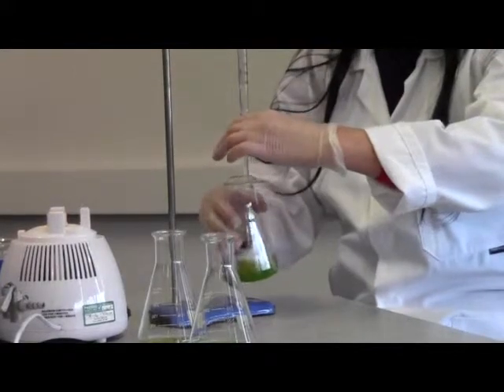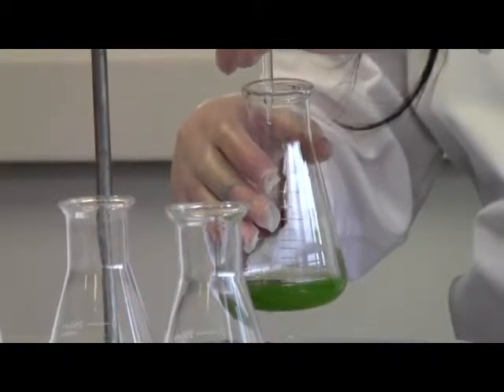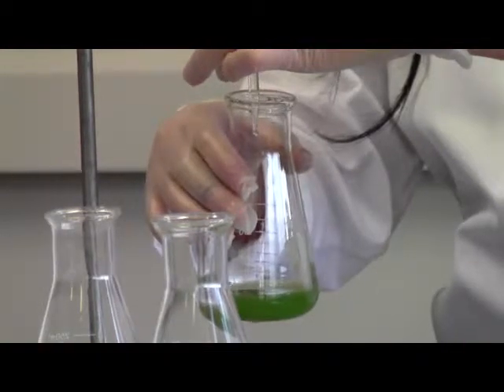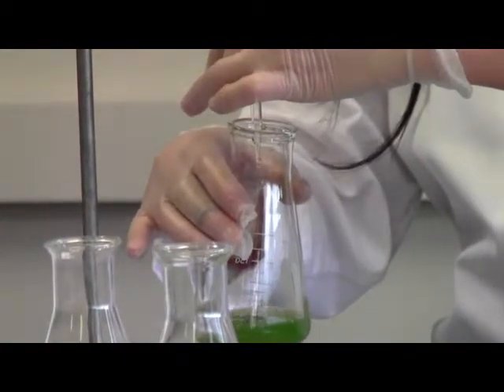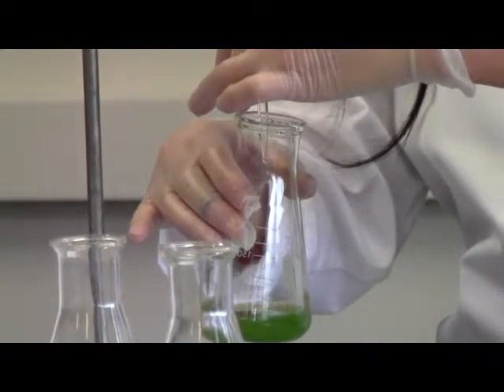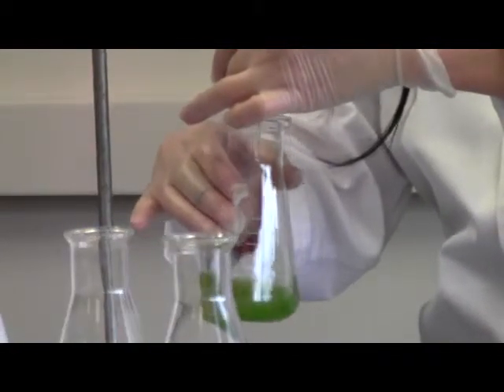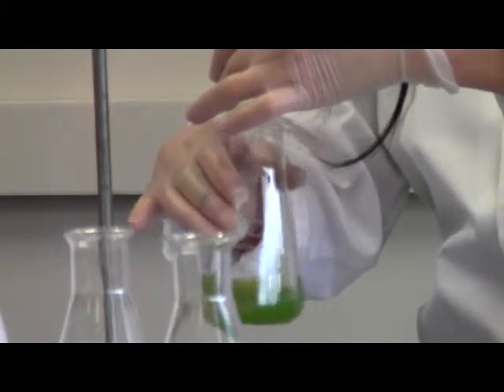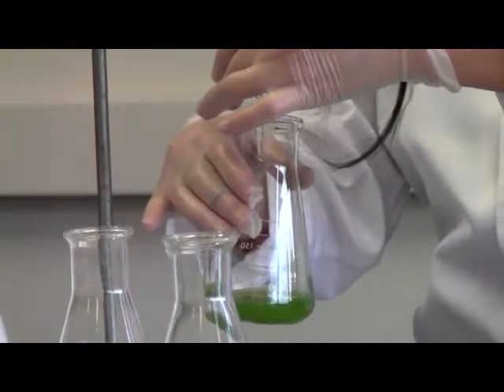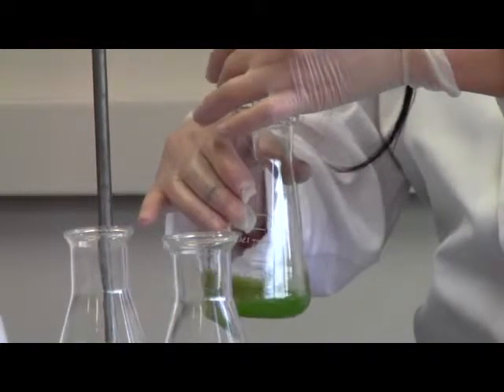Use your right hand, shake slowly, and the other hand starts to do a drop. I would like to be careful, slowly, drop by drop, to see how the reaction goes in the flask, and then accurately read. The first sample can be a test. If you are careful, by the end, if the data is reasonable, you can still use it.